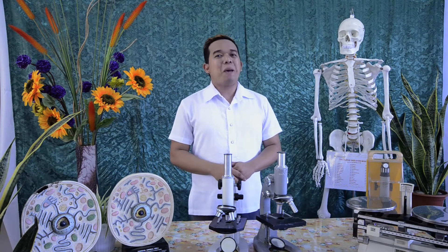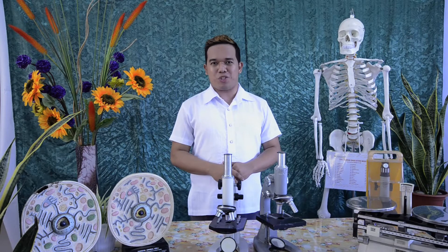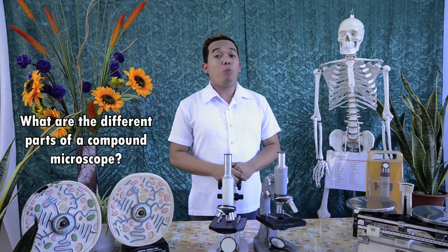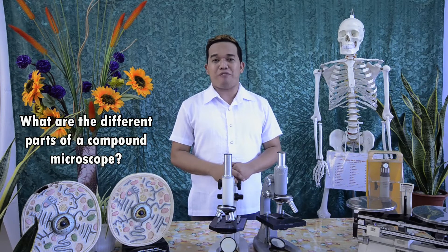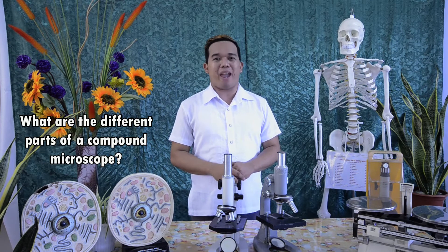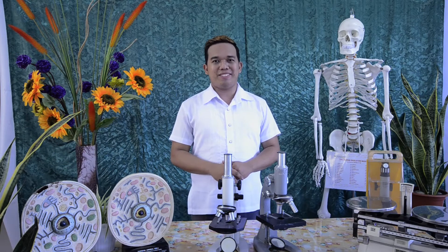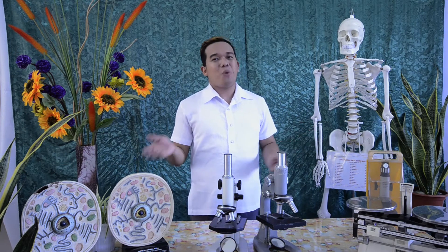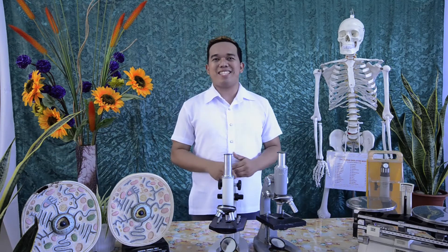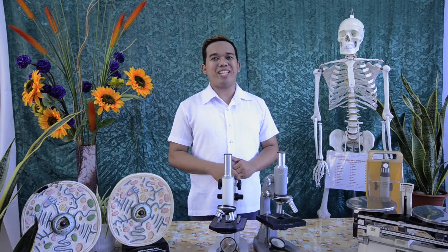But before that, please take note that you will be answering these questions: What are the different parts of a compound microscope? How do they work? So I guess we are all set. Let's watch this short clip.